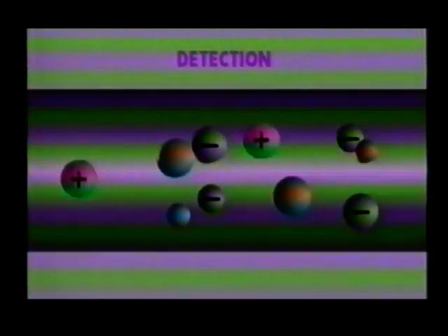As the field strength is very high in the sample slug, the analyte ions migrate very rapidly until they reach the leading interface with the running buffer. Larger injection volumes than normal can be used, and analytes can be concentrated, typically up to 10-fold, into a sharply defined band. This effect is known as stacking.